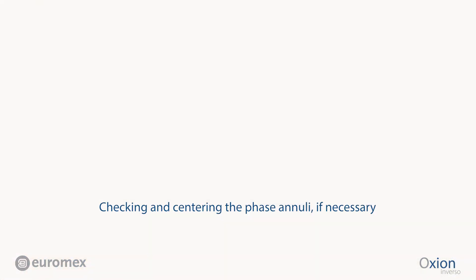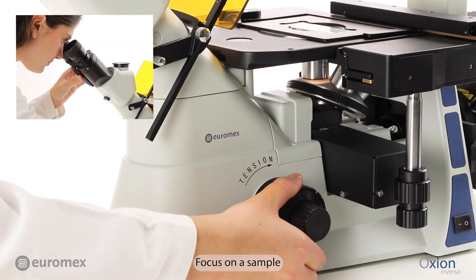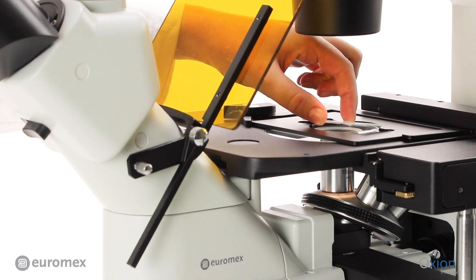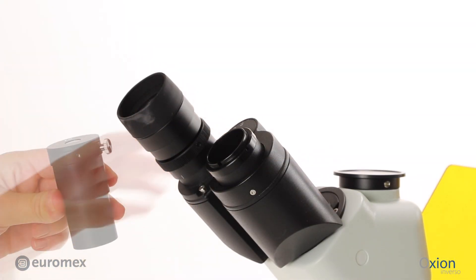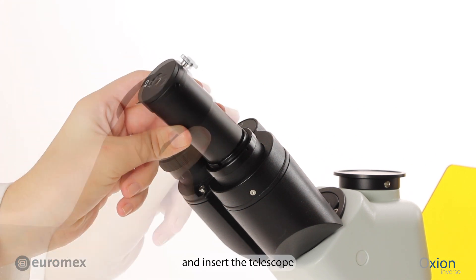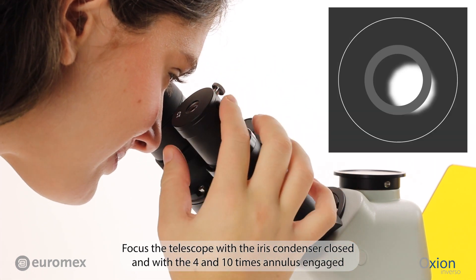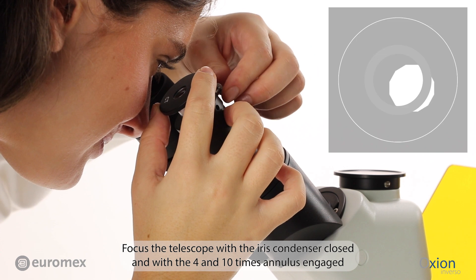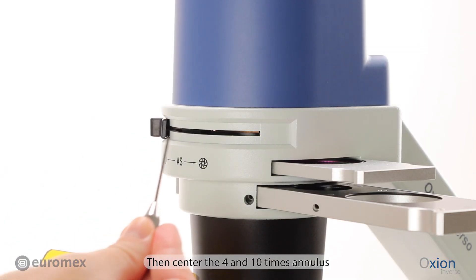Checking and centering the phase annuli, if necessary. Choose the 10x objective and focus on a sample. Remove the slide, take out an eyepiece, and insert the telescope. Focus the telescope with the iris condenser closed, and with the 4 and 10x annulus engaged. Then center the 4 and 10x annulus.